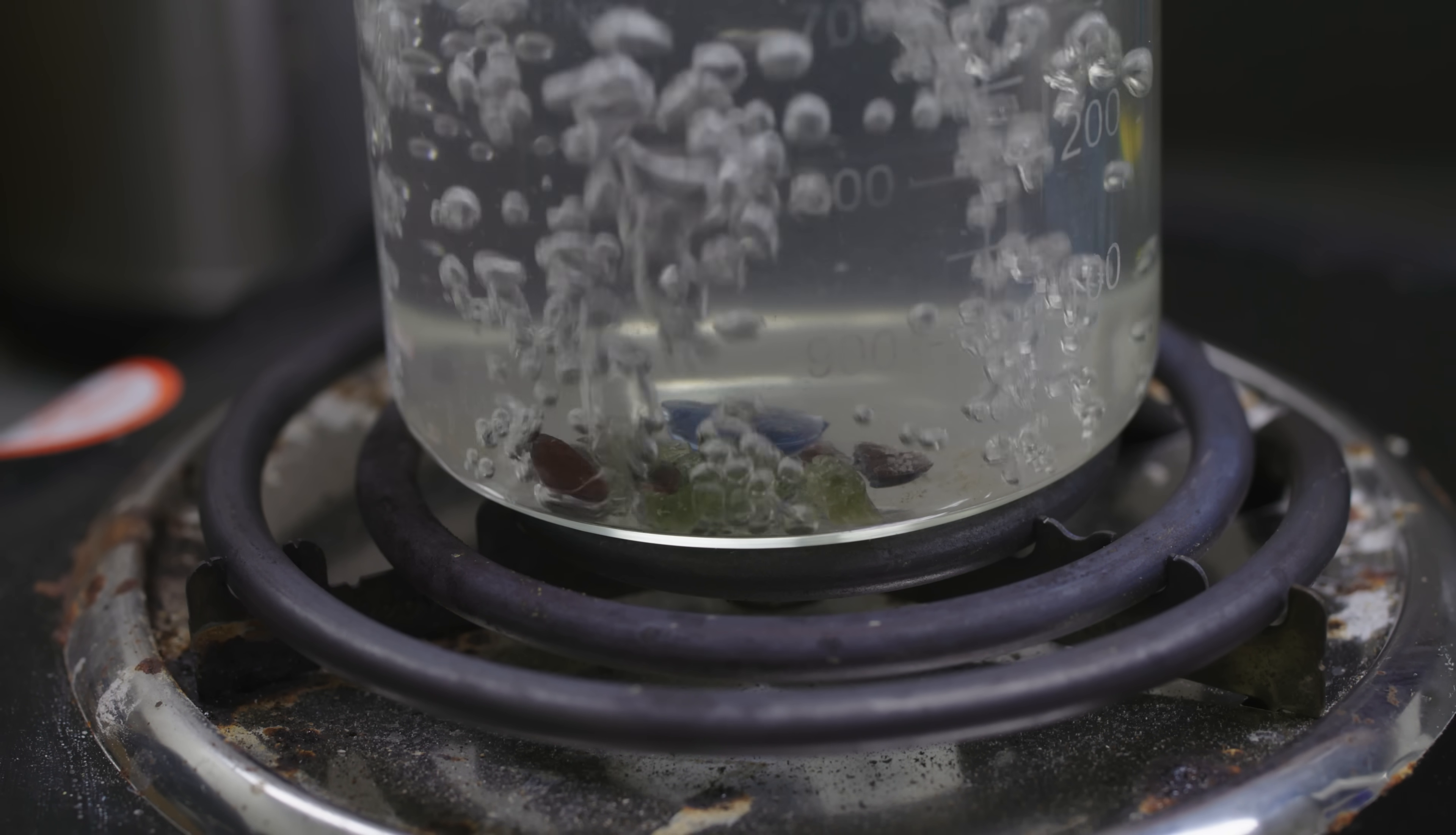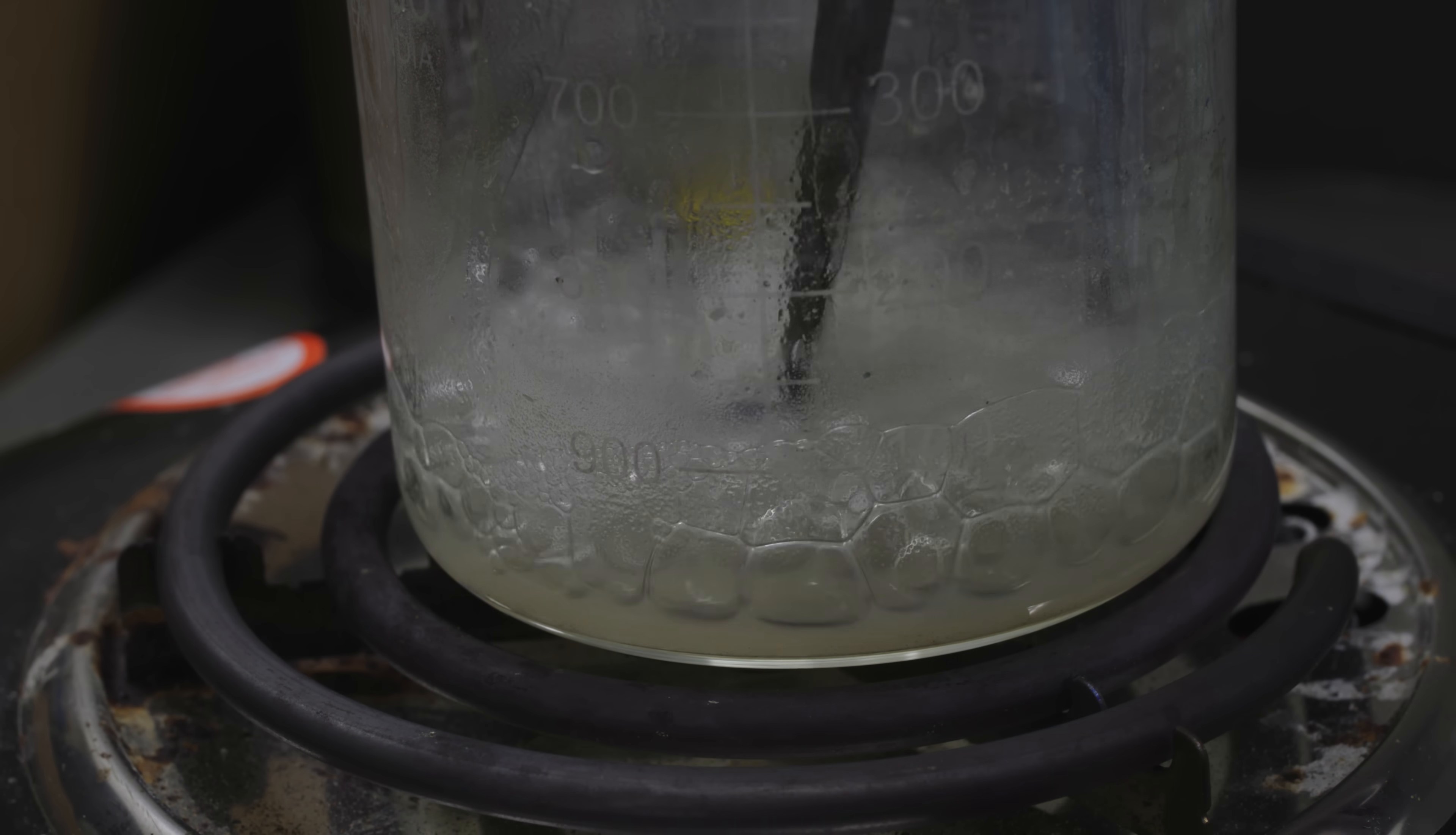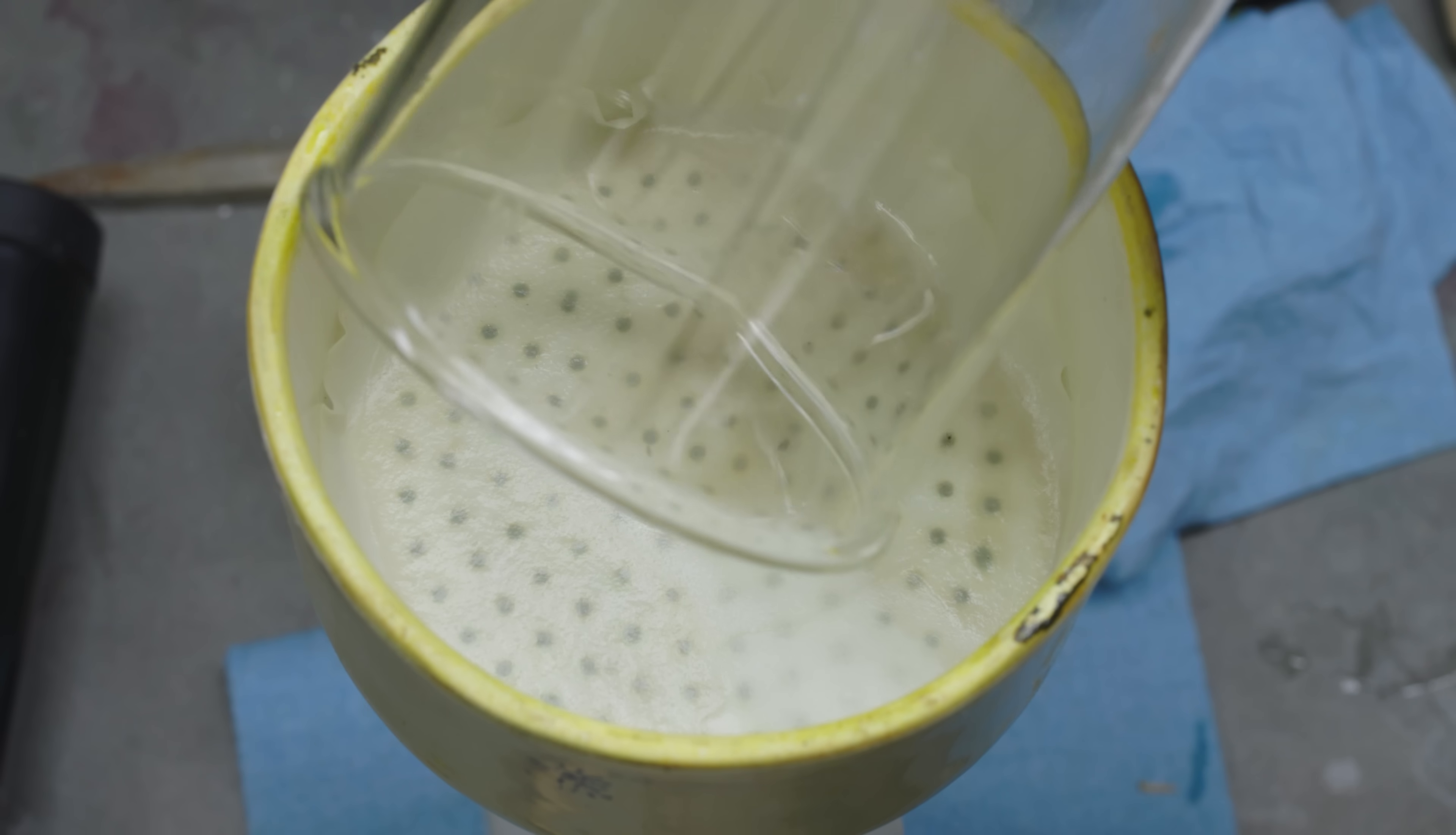So a lot of the smaller pieces did dissolve, but these larger ones are being super stubborn. And being the impatient man that I am, I really don't want to watch these things dissolve over the next three days. So I'm just going to go ahead and strain it over a paper filter. And we're going to see if we can find any gold in here.